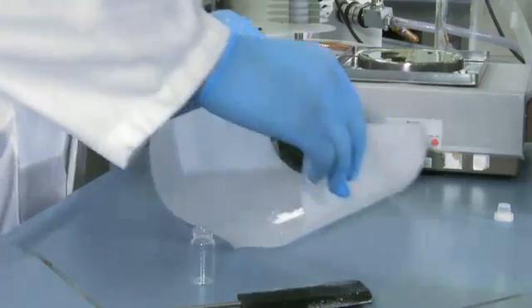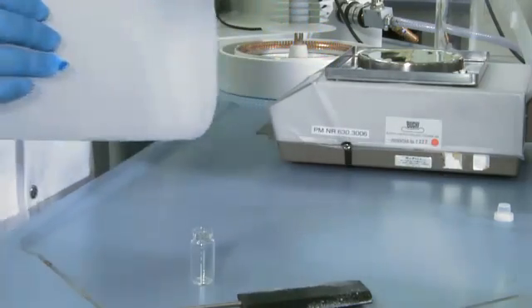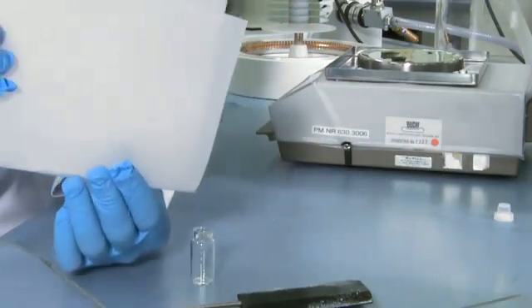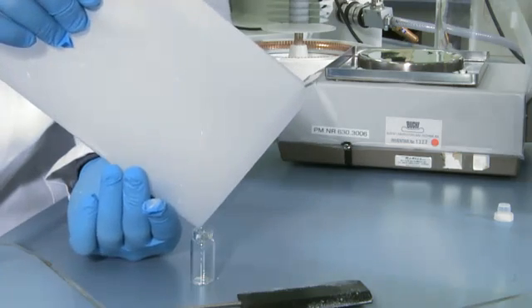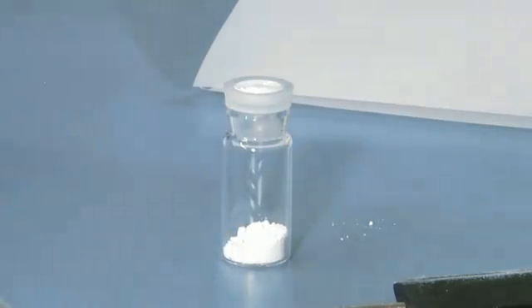Finally, fill the particles from the collection paper into a pre-weighed container. The experiment is now finished.